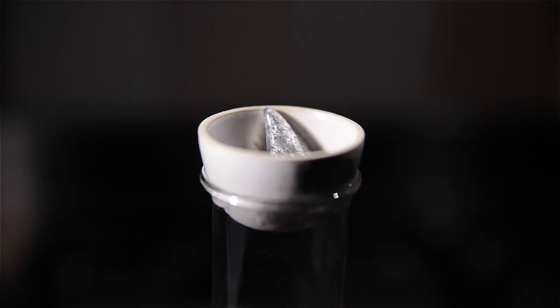I normally prepare a specific shape in advance by steaming in a ceramic crucible over a conical flask. This avoids overheating the alloy and also avoids having to decant off water if you melt by submersion.